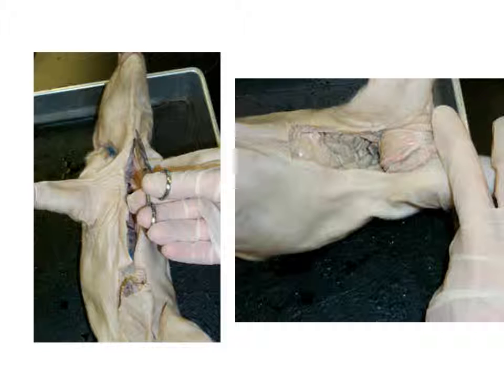The U-shaped cut that goes down toward the pelvic region is particularly handy for keeping the umbilical veins and the ureters and all that from being damaged by your incision. So just going down the middle is not a great idea. So do pay attention to that format.